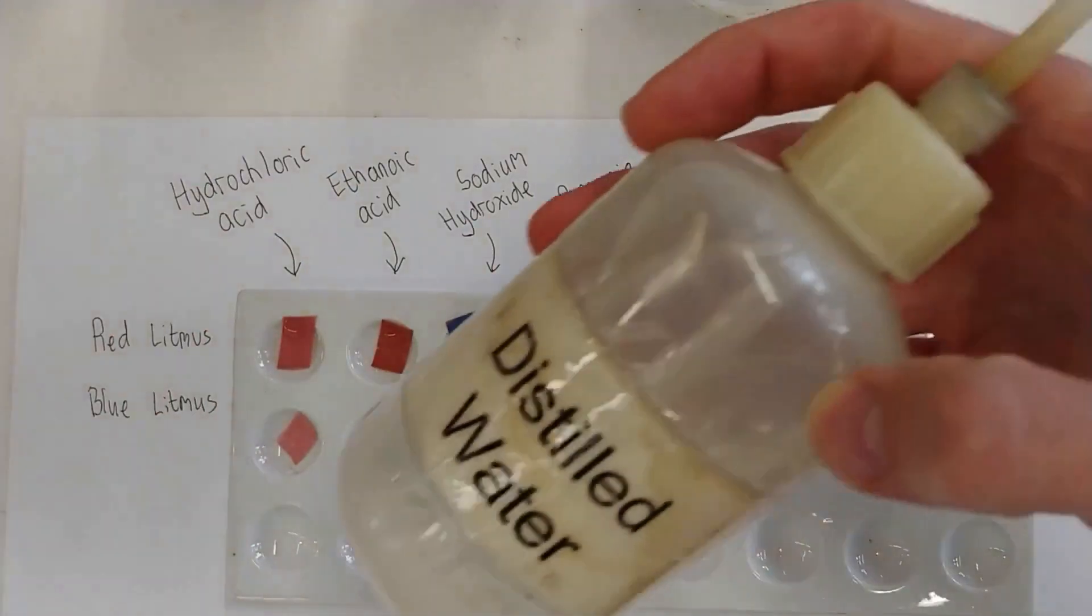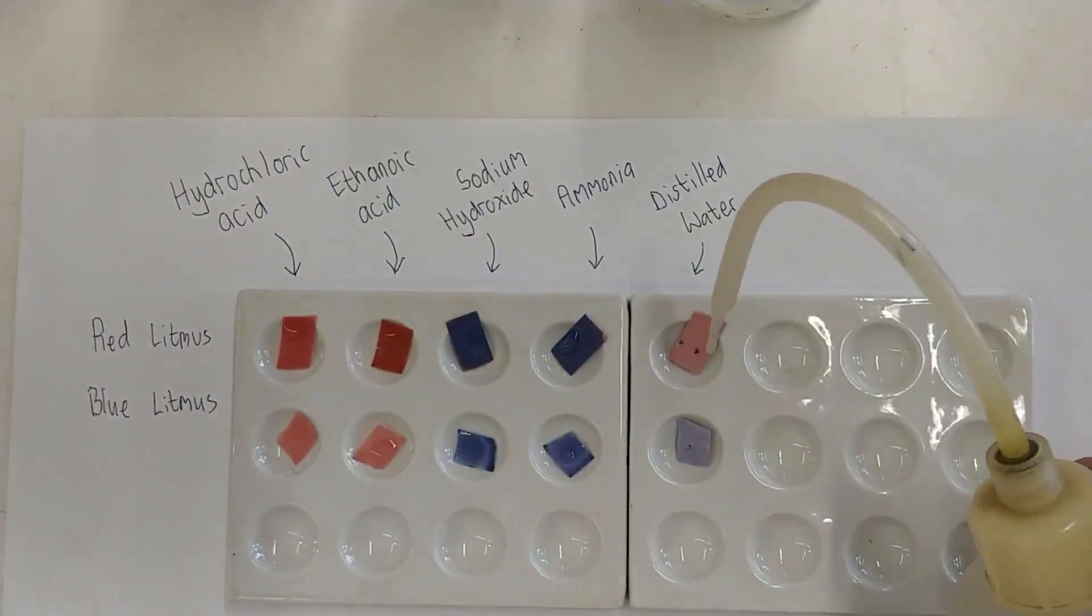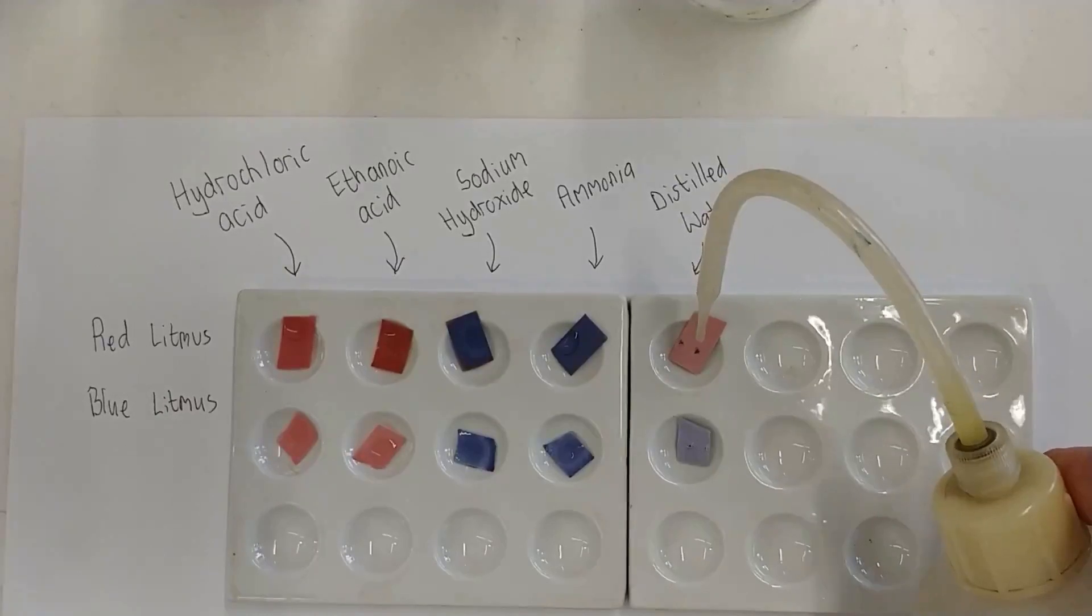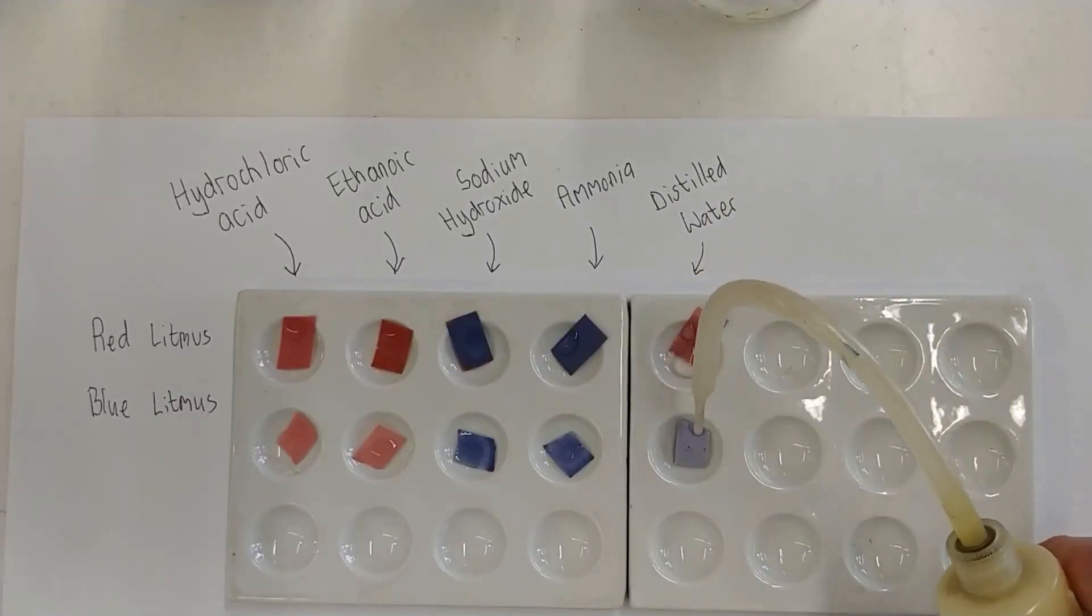Finally, the distilled water. Well, this one is just in this bottle, so we can squirt it out quite easily. And it doesn't change anything.